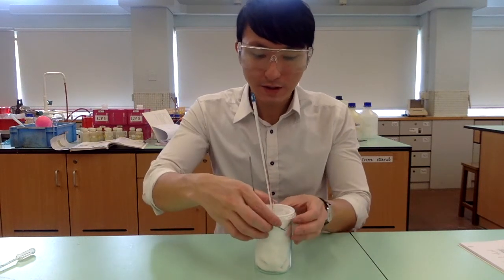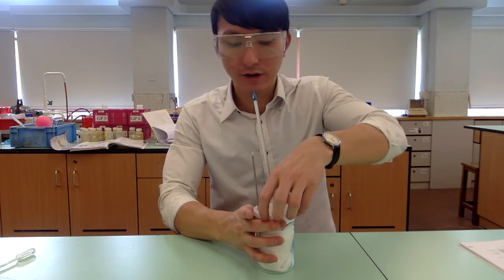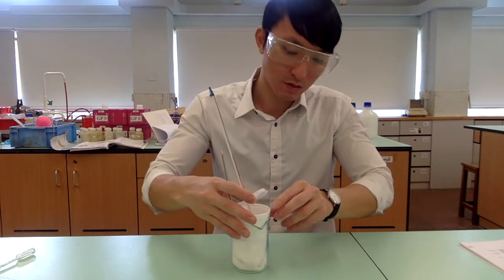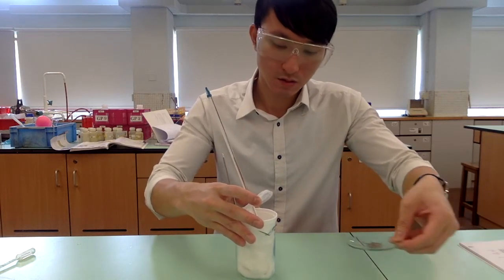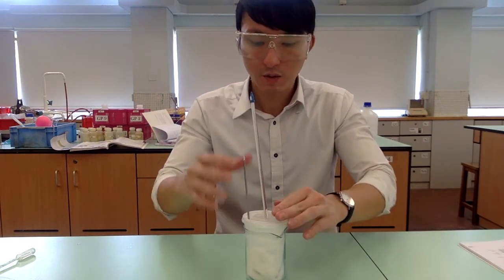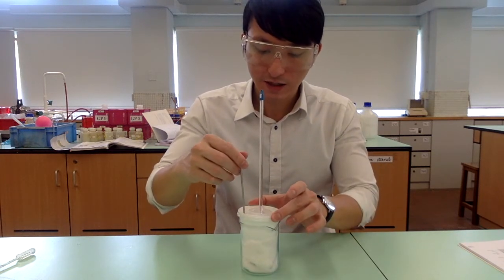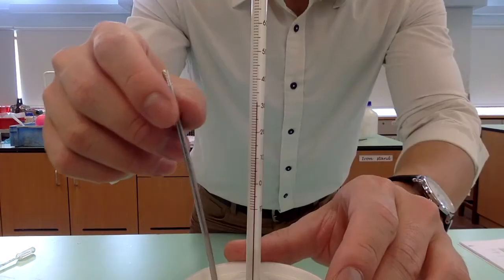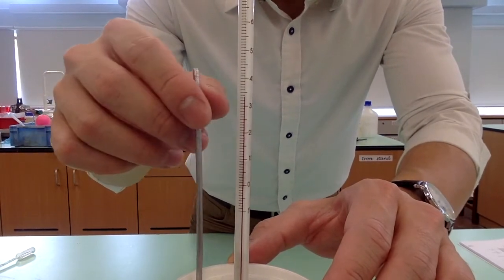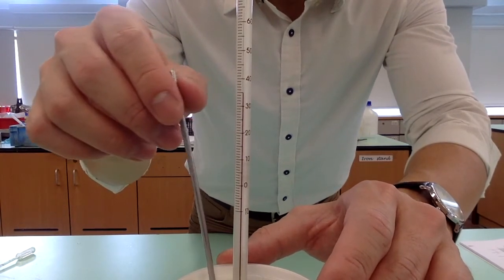Now, open the lid and carefully transfer all the calcium granules into the acid. Close the lid quickly after transferring the solid, and then use the stirrer to gently stir the mixture. The temperature should be increasing, as the reaction between calcium and hydrochloric acid is exothermic. Monitor the temperature rise until you register the maximum temperature.